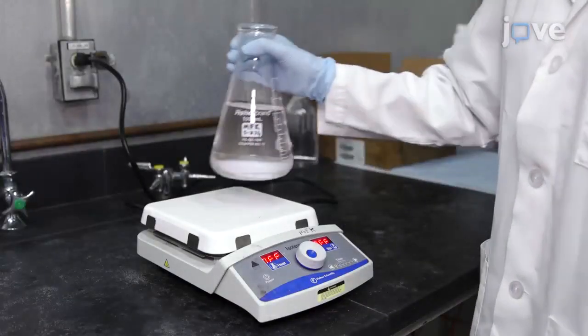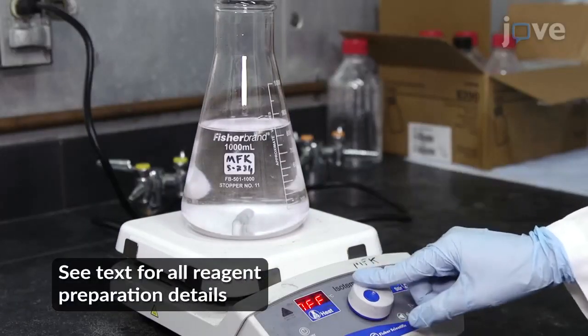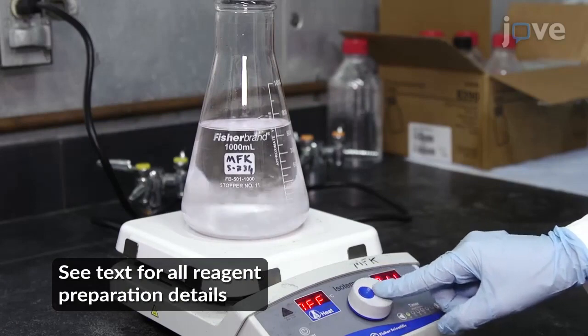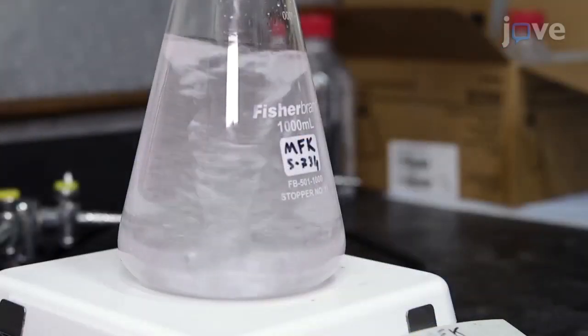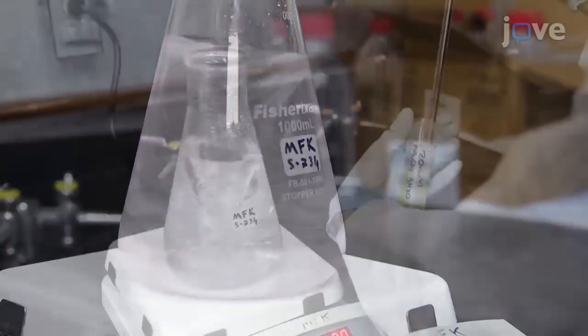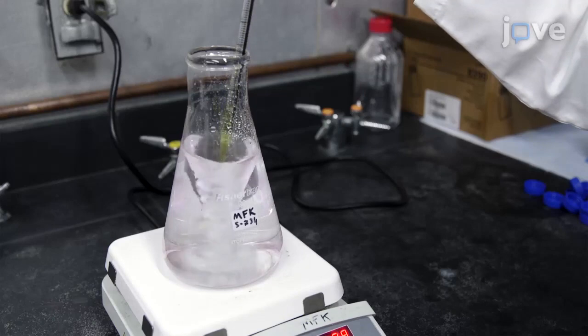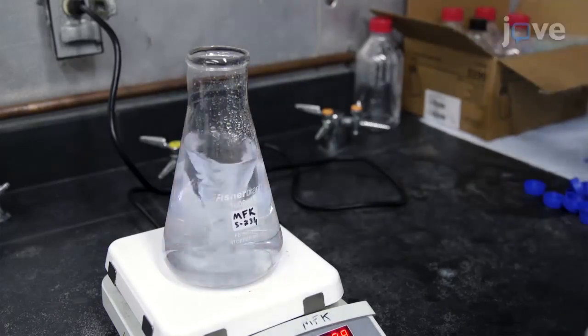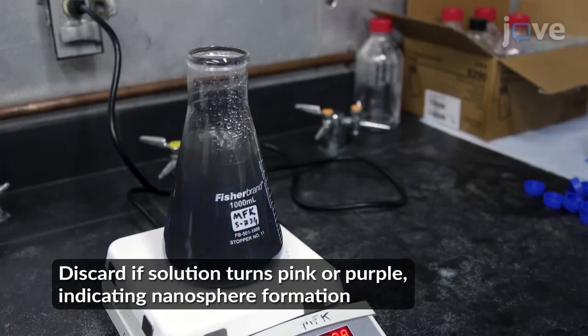For gold nanostar core synthesis, place a conical flask containing 800 milliliters of freshly prepared ascorbic acid solution on a magnetic stir plate at 4 degrees Celsius and induce a steady vortex. Quickly add 8 milliliters of freshly prepared tetrachloroauric acid solution to the vortex. Within seconds, nanostars will form and the solution will assume a dark blue color.